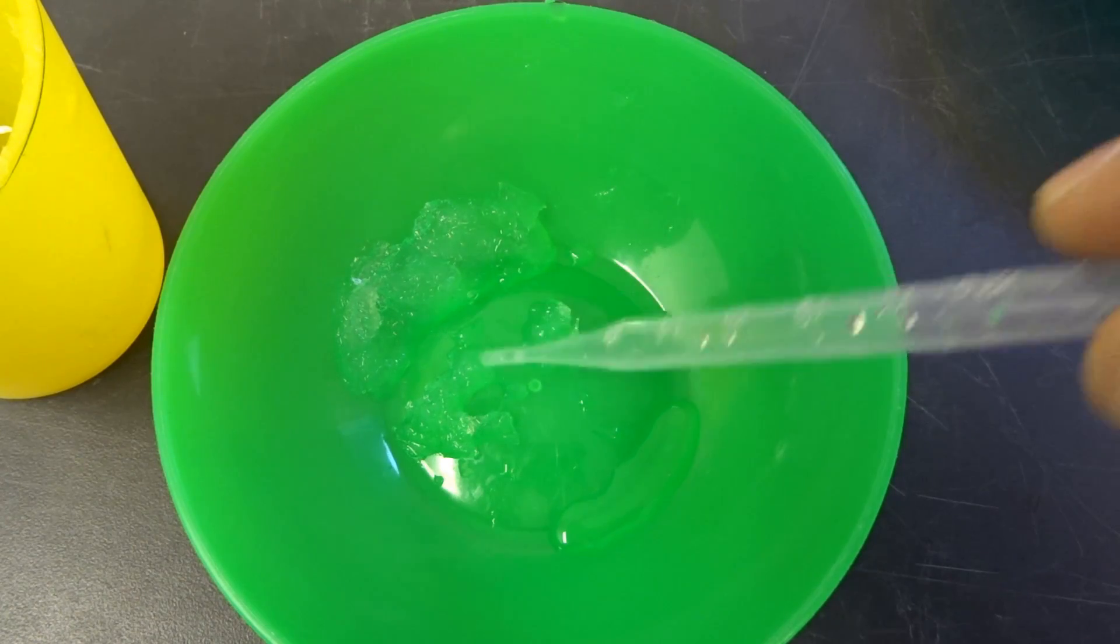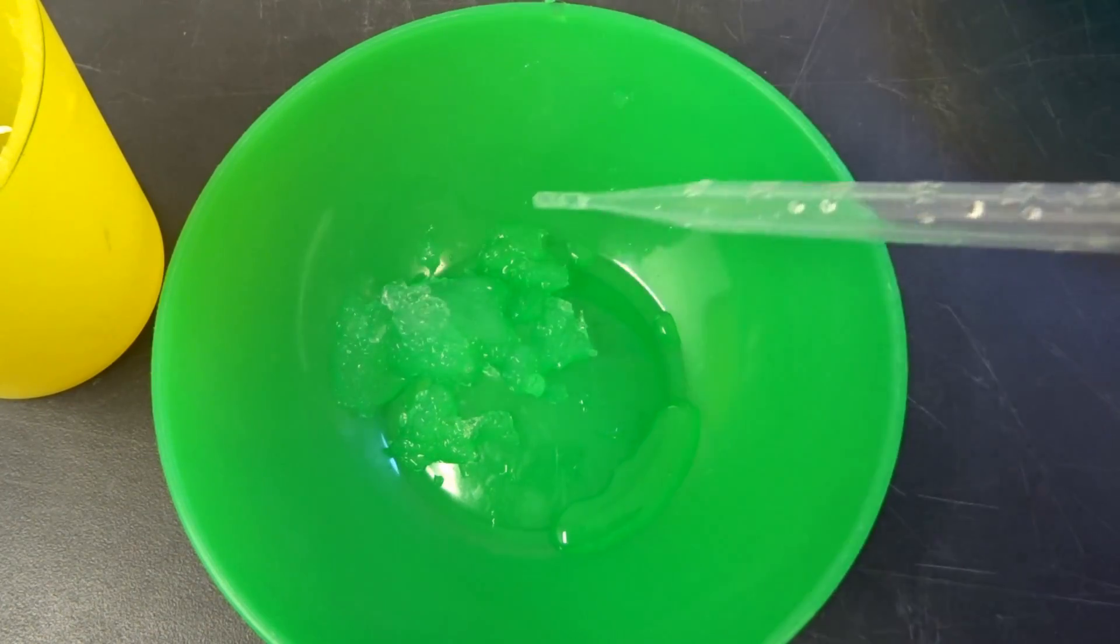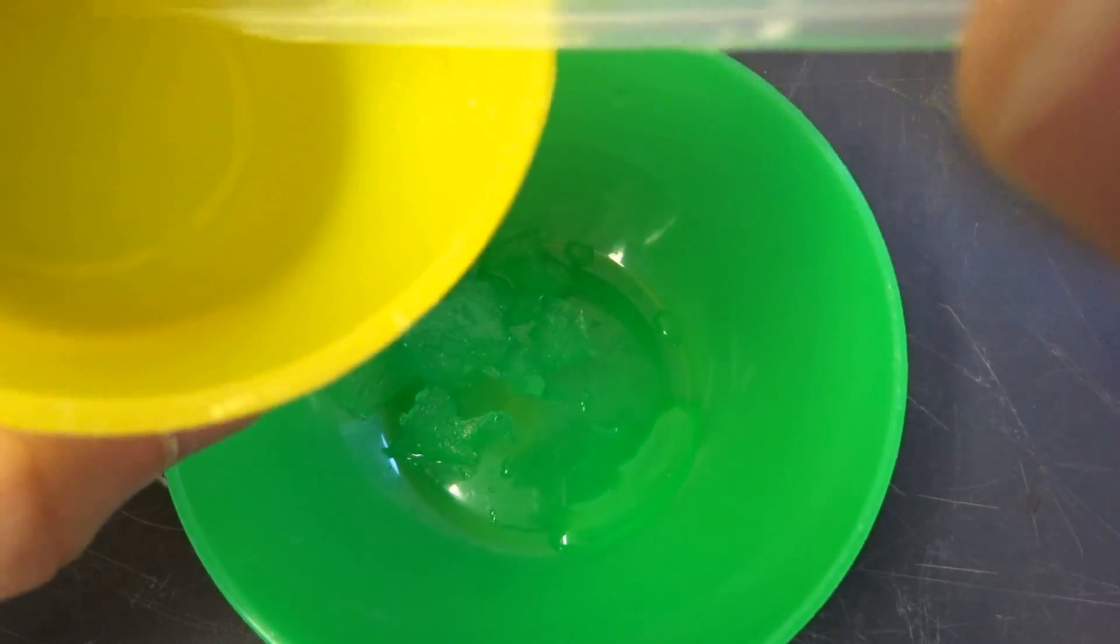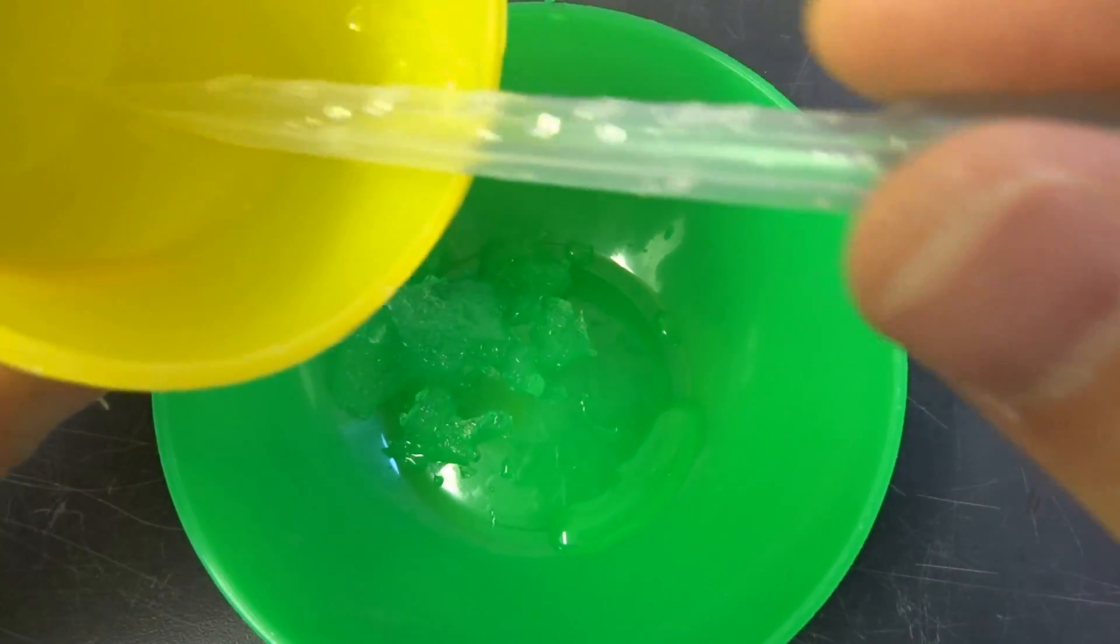And why do they shrink, and what can we do against the shrinkage, especially without supercritical drying, because building this stuff is pretty dangerous if they're in use and they explode, so they're high pressure.